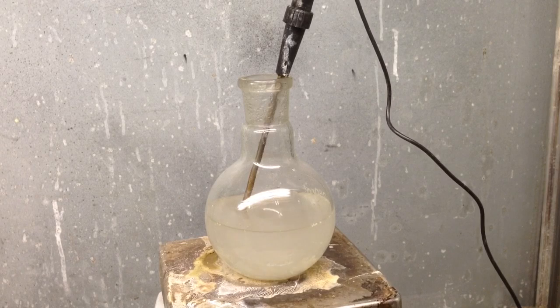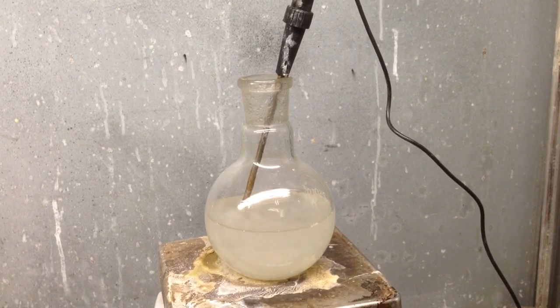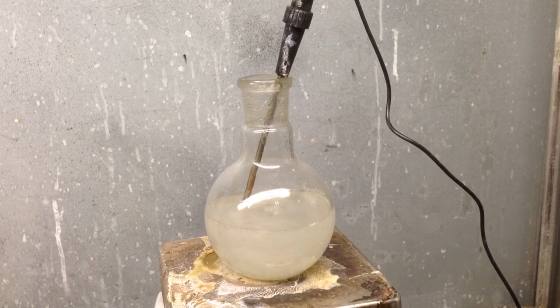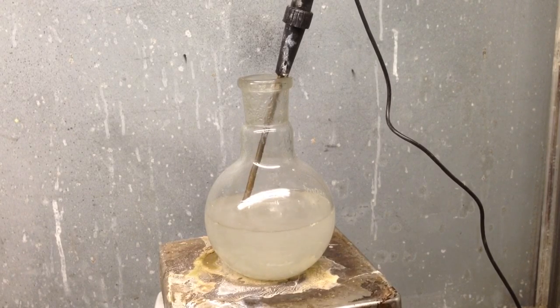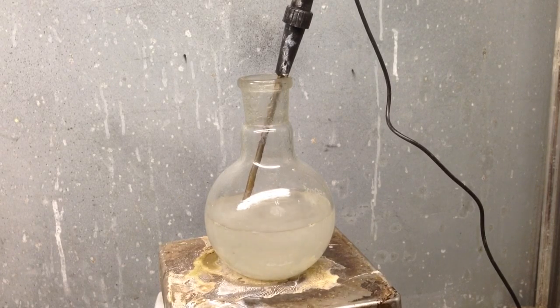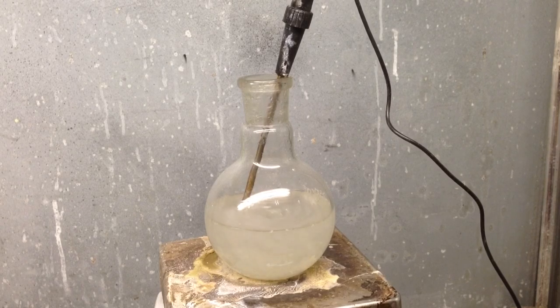Alright, so I've been letting this heat up for a little while. It's at a hundred degrees Celsius. It's starting to boil. As you can see, you can continue and you can let this boil until the bubbles get thick. They'll get into like a thick syrupy bubble. You can pick it off right now if you want. This is what I'm going to do.